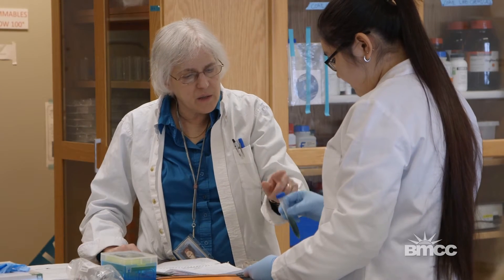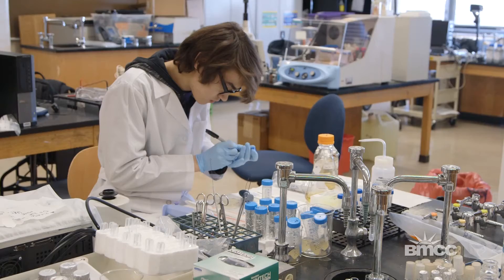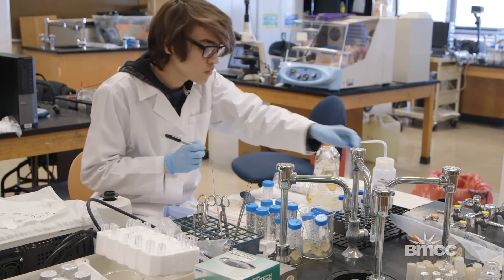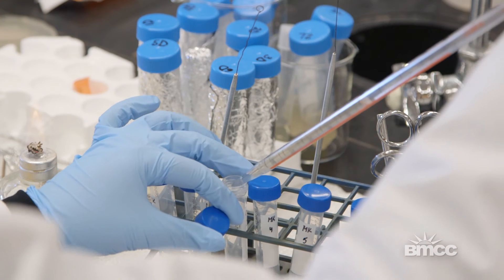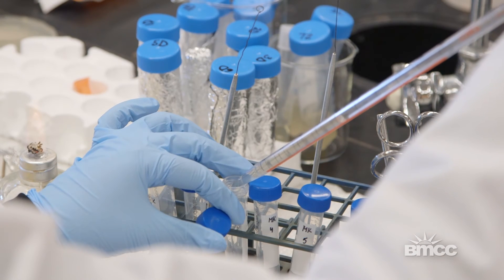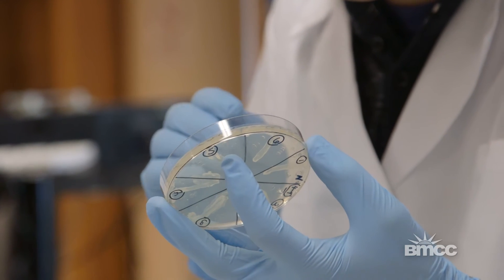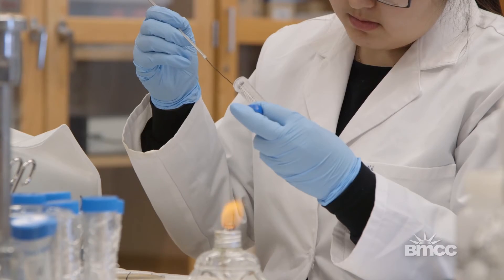Part of learning how to do research is being trained in the methods. We spend a lot of time on microbiology methods and on molecular biology methods. It gives them a boost in their academic career and an advantage after they transfer to a four-year school. They have the experience to do research.